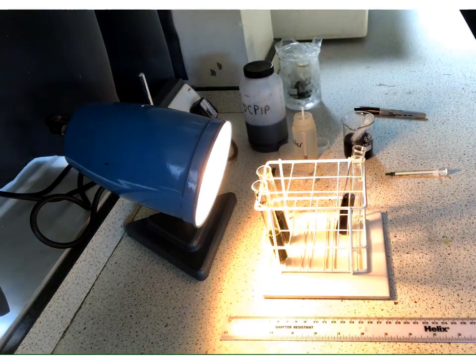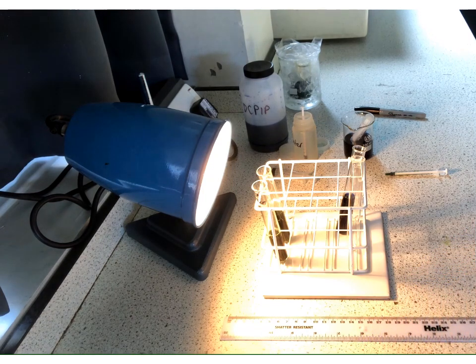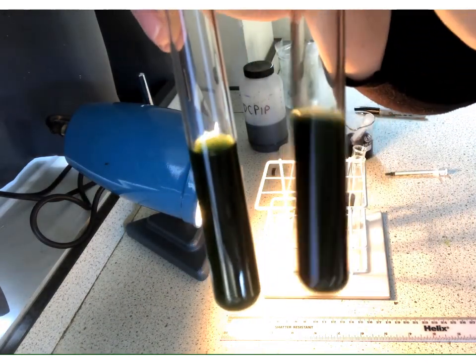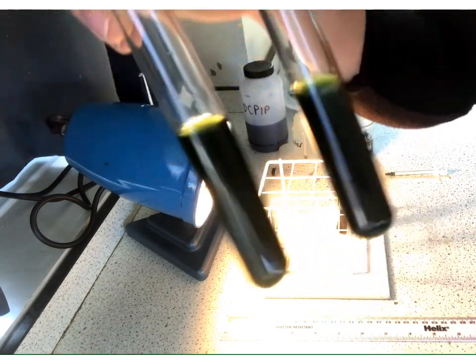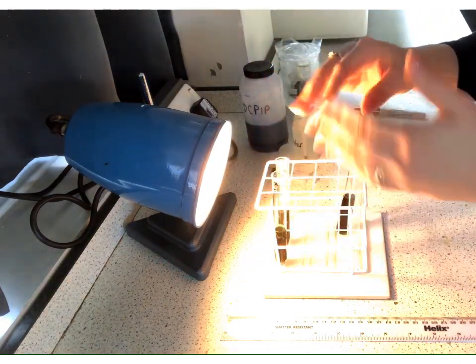Okay. In fact, I would say we are there. Okay, so you can see if you agree with me. This is our control that we know has worked, and this is our test here. I think they are pretty much the same. Obviously, you can pull this investigation to pieces in terms of judging things by eye and not using a colorimeter. Okay, and the idea being we would repeat this multiple times.